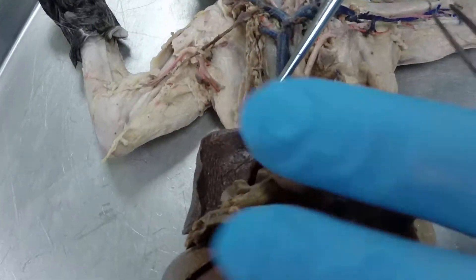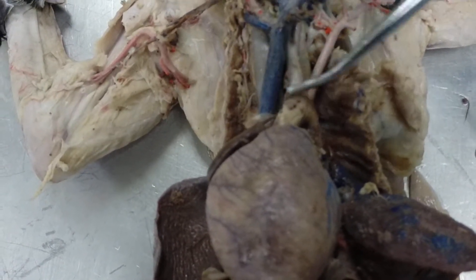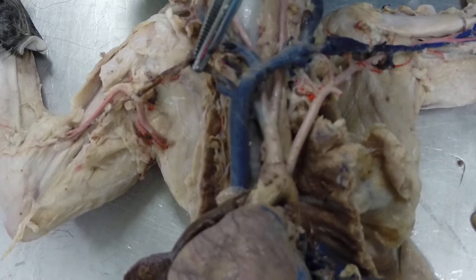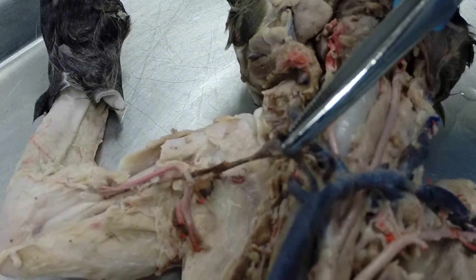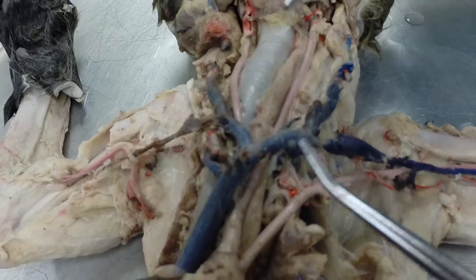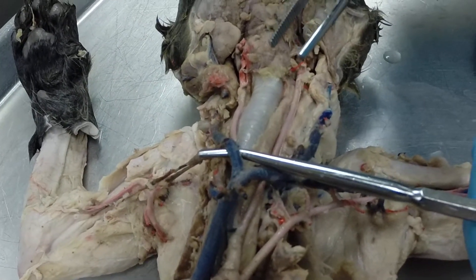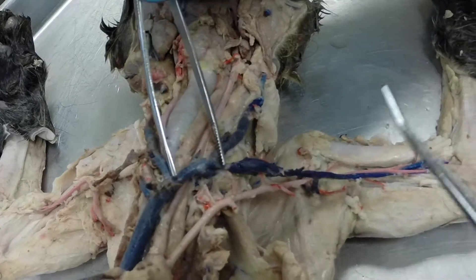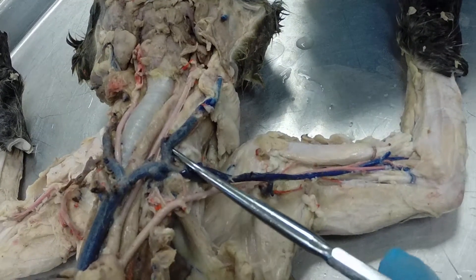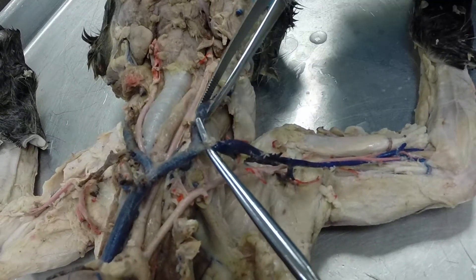Going back up to the chest area and cephalic region, here we are at the heart again. Coming off the heart, this is called the pre-cava. Going perpendicular to the pre-cava, we have this vessel called the internal mammary vein — it's illustrated very poorly in your lab manual, so make sure you know that one. The pre-cava is going to branch into the left brachiocephalic vein and the right brachiocephalic vein. The brachiocephalic vein branches into the left external jugular vein and into the left subclavian vein.